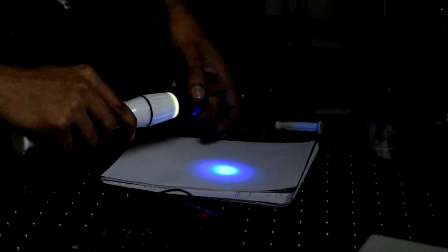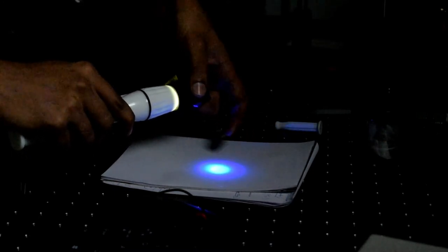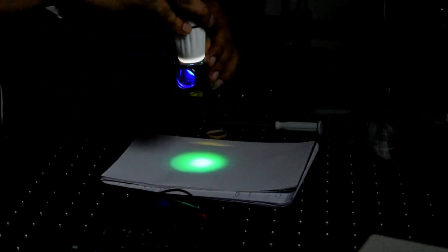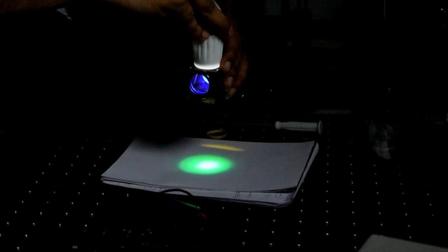White light passes through the excitation filter, reflects off the dichroic mirror to the sample plane, and blue light goes to the sample. If the sample emits green light, it passes through the dichroic mirror and emission filter to the detector. This is a very cool technique.